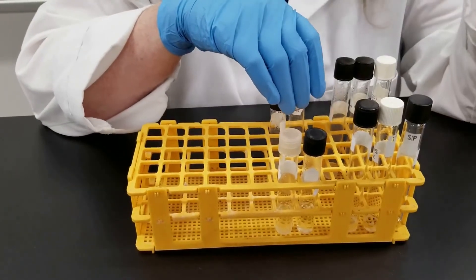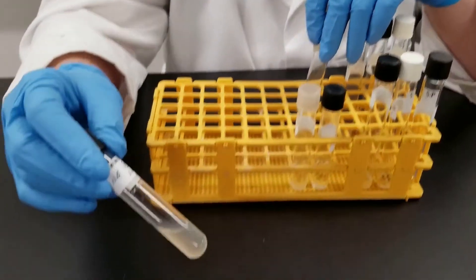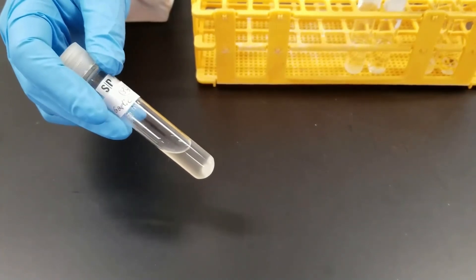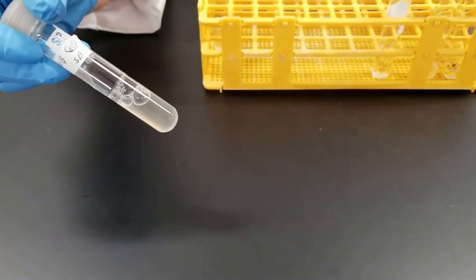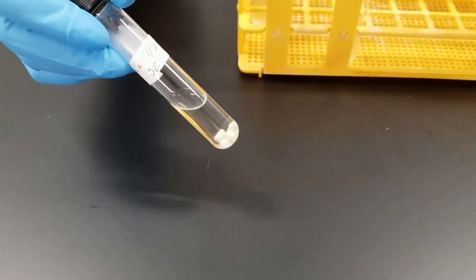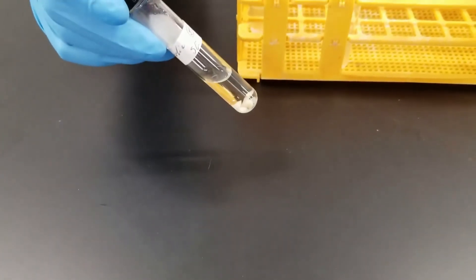The first thing we're looking at is garlic, which has often been claimed to have inhibitory effects. The Enterobacter in regular nutrient broth is cloudy — that indicates lots of good growth. Compared to the tube that had garlic in it, there is some cloudiness, so apparently the Enterobacter likes garlic — it did not inhibit its growth. Now the Staphylococcus epidermidis in nutrient broth also had growth. But in the garlic tube — see how clear the liquid is? There is no growth at all. So garlic did have an inhibitory effect on the Staphylococcus, but not on the Enterobacter. It depends on which species you're looking at.